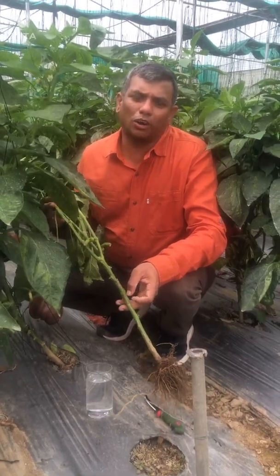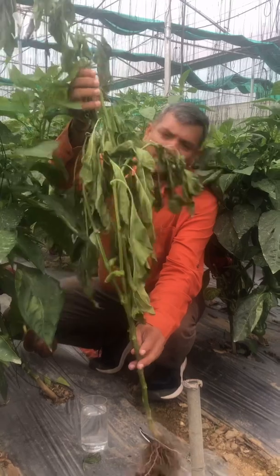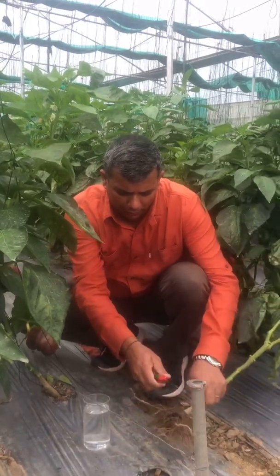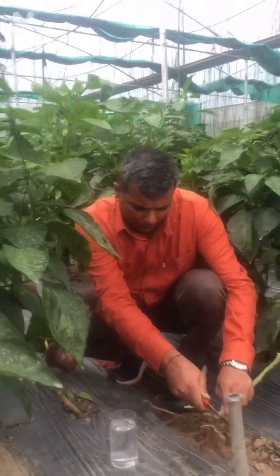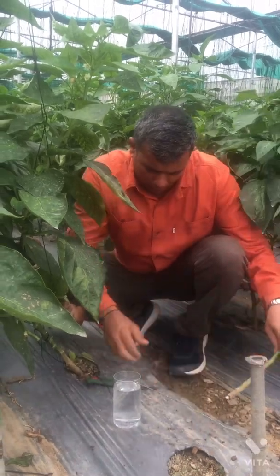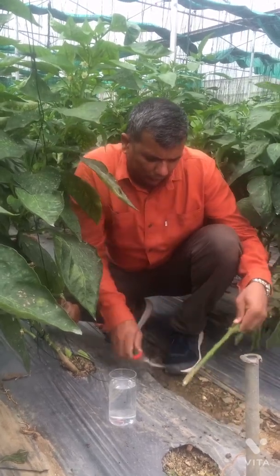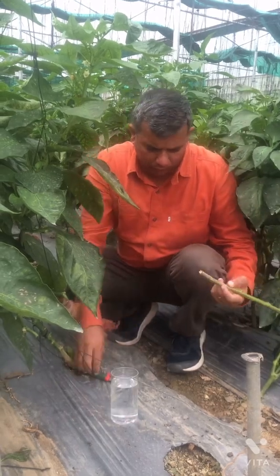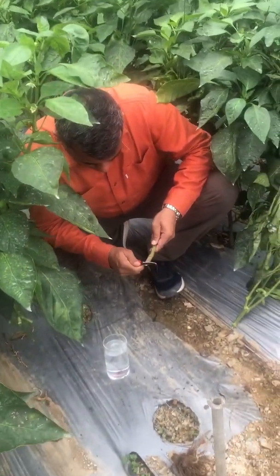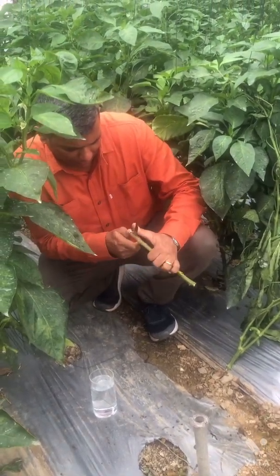I am going to show you how to diagnose and confirm this bacterial wilt. We have uprooted a plant which has wilted, and after uprooting we are going to cut it, get the root out, take the stem portion, and make a nice cut halfway into it to see what is inside.